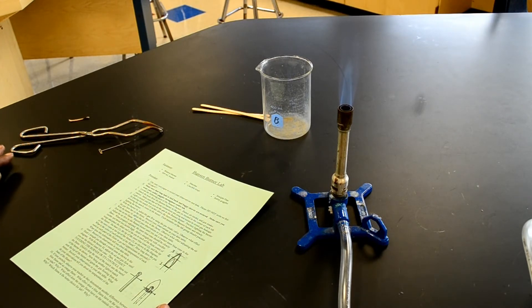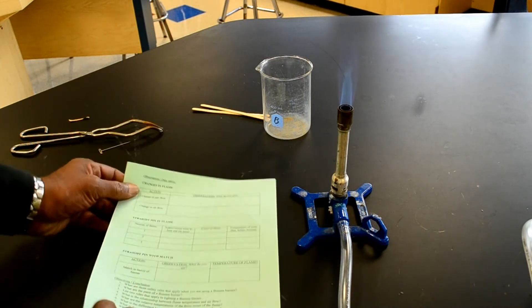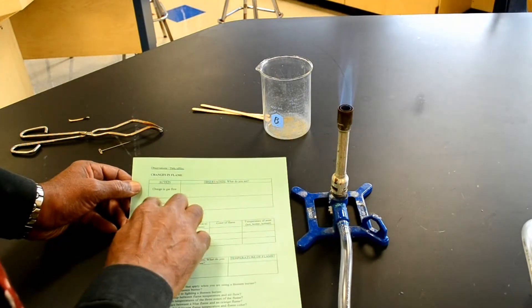Then it says, record your observations in your data table. Over here is your data table. Now record your observations here.